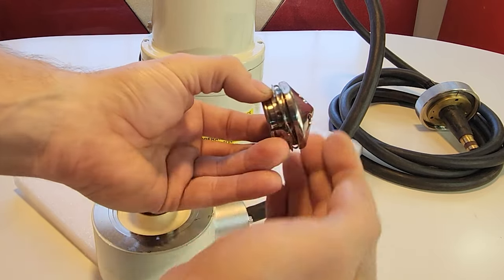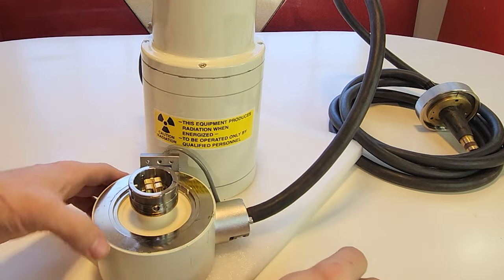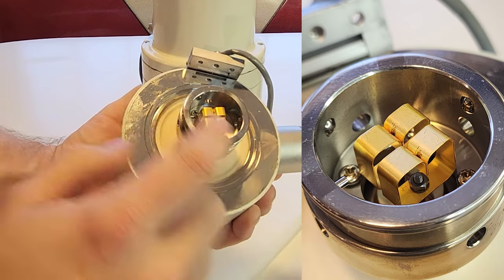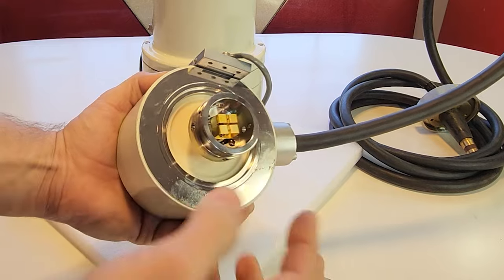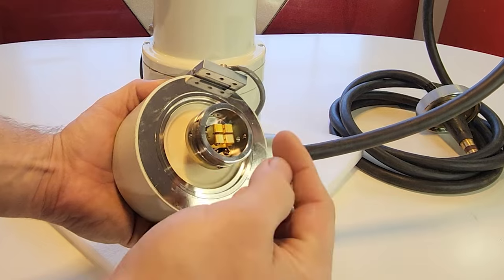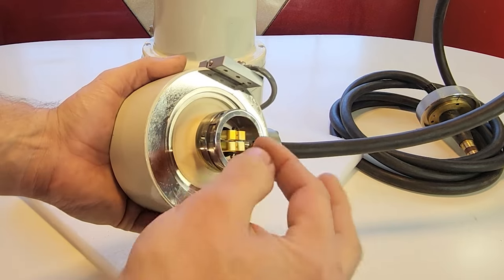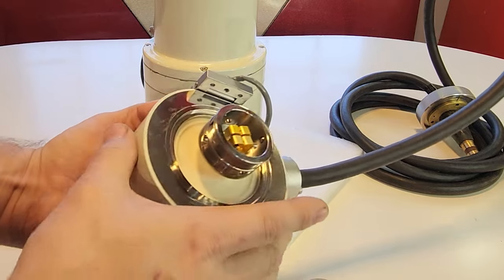This acts as your primary electrode that does the accelerating. There are gold-plated contacts inside that make contact with that electrode. The reason there are two is because of the filament — it's heated up at around six volts, a few amps, to get it glowing. When it's that hot, it allows electrons to come off more freely; it basically boils them off. This whole metal ring is part of the main electrode — electrically insulated and held at a higher potential to then be accelerated for later use.